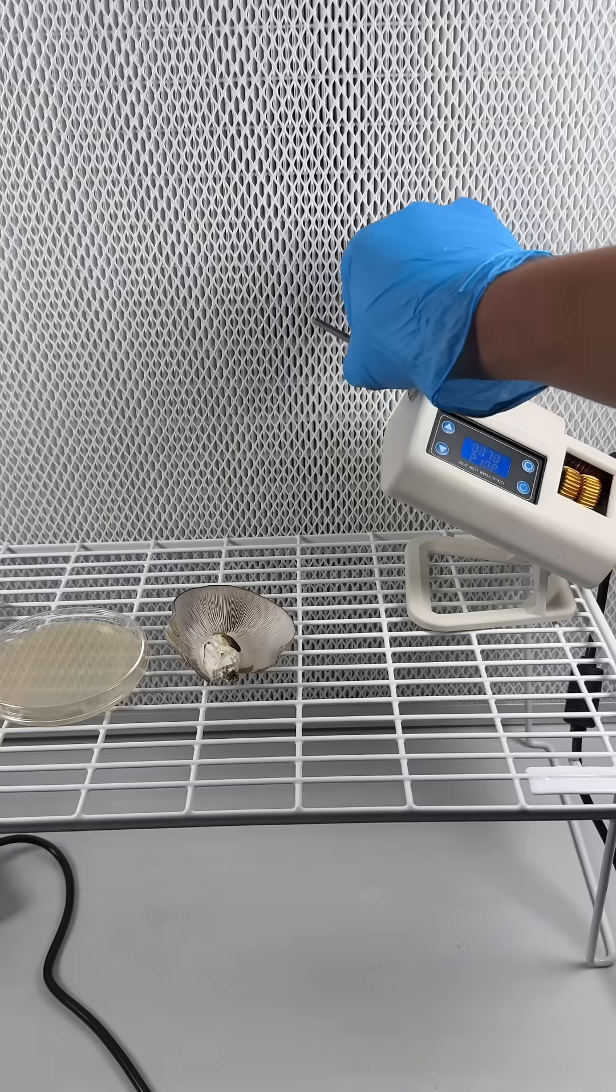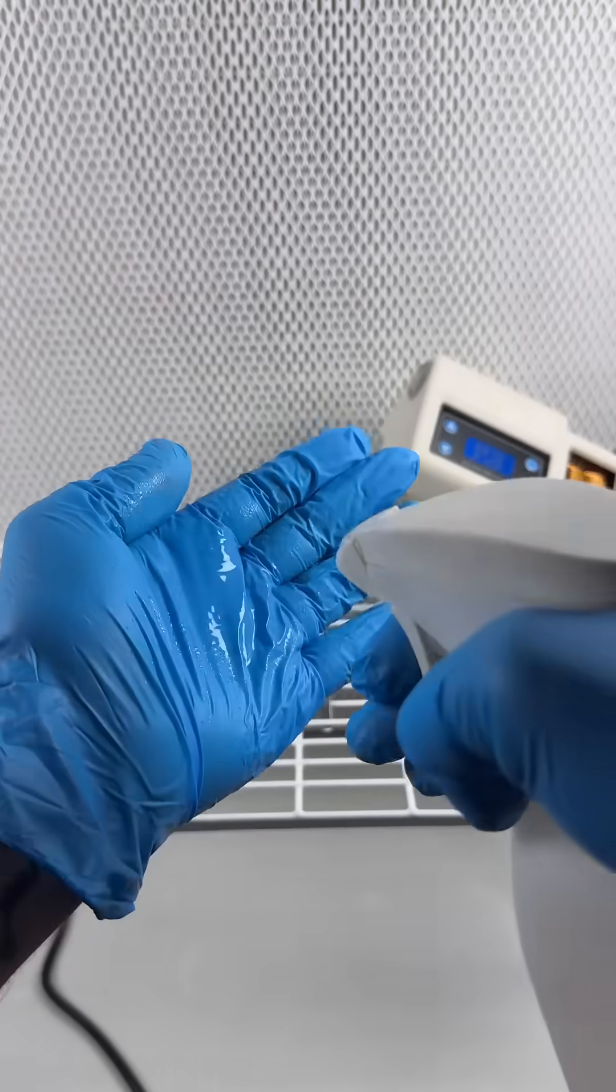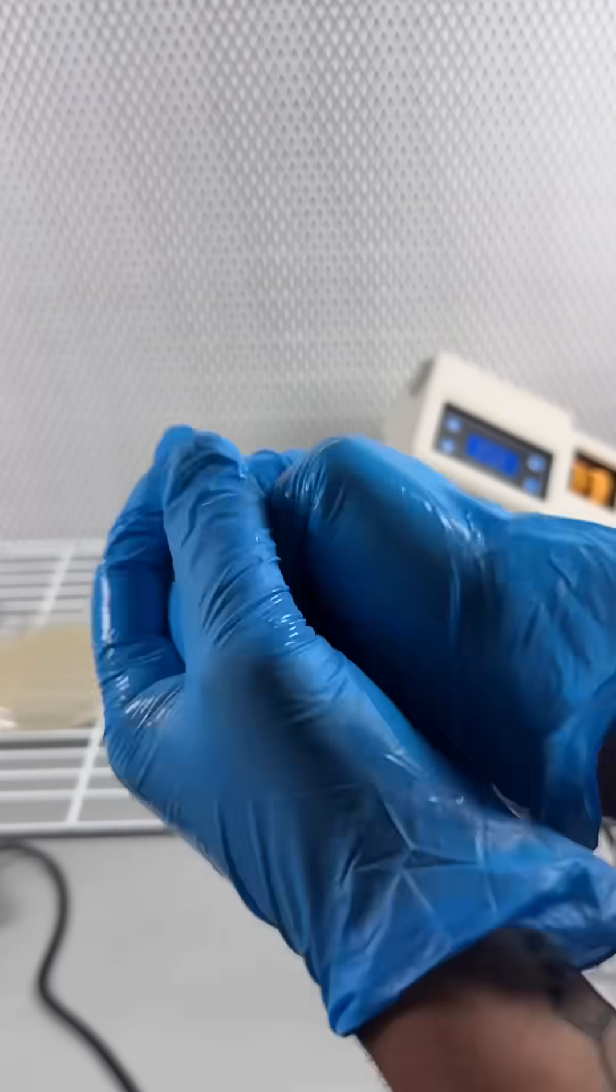We ate most of the mushrooms but I saved one of them and brought it into the lab so that I could clone it and propagate the mycelium.